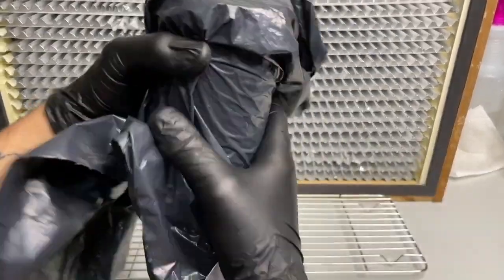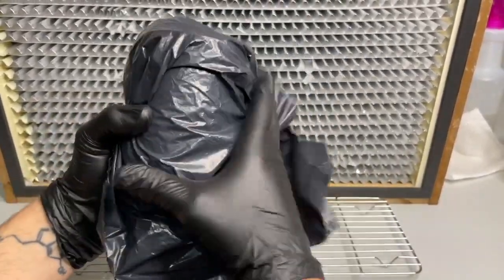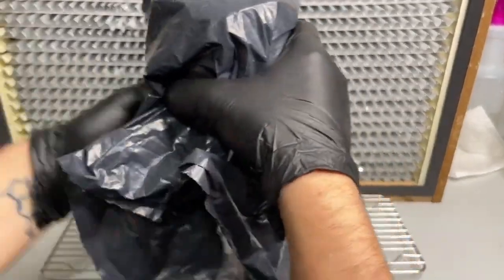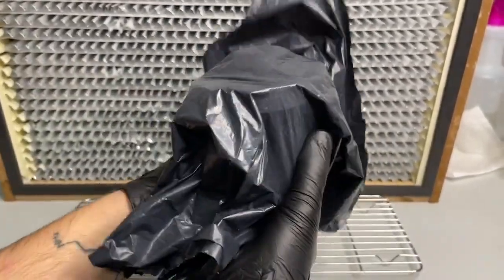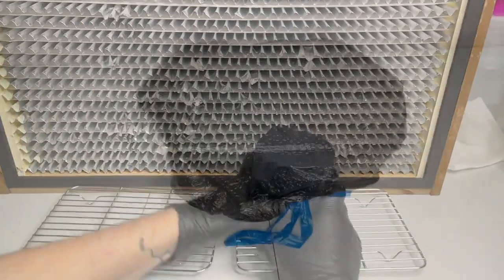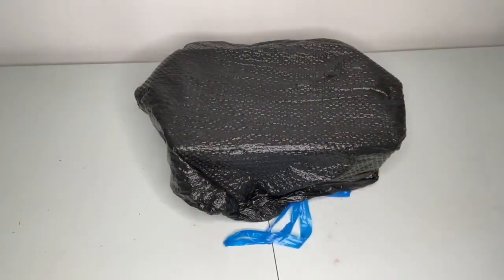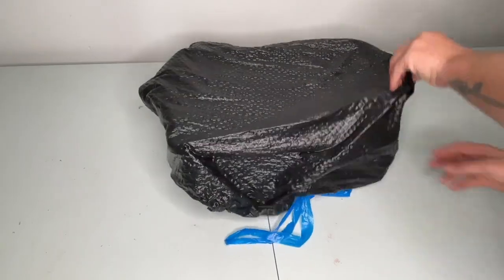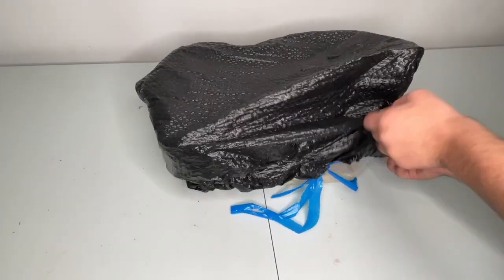It is important not to incubate longer than 3 to 4 days or you will run into a problem called overlay. If the substrate is not exposed to lighting after 3 to 4 days, the mycelium will become very thick on top of the substrate and it will prevent any growth.